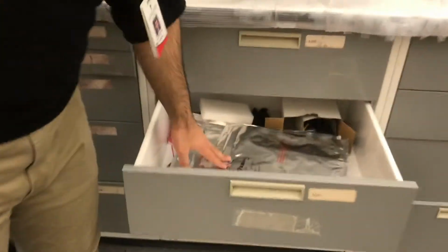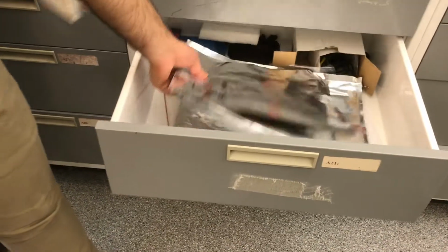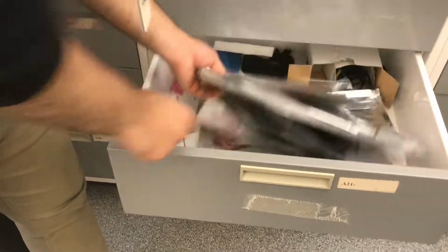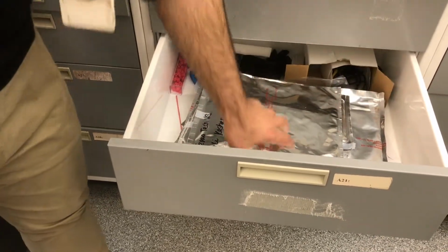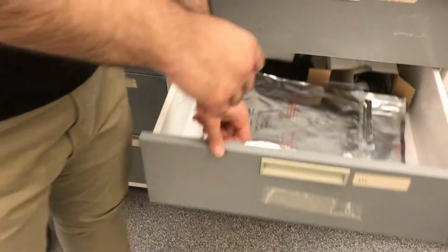The photo masks are here. We put the photo masks in order based on the dates they arrived. For example, this photo mask is the first that arrived, and this one is the last that arrived. So do not change the orientation of those, because otherwise we couldn't understand which one is which.